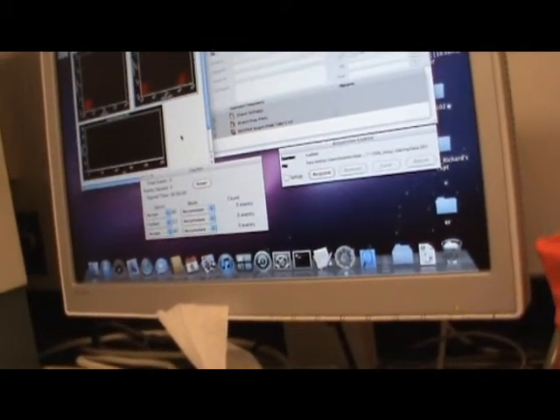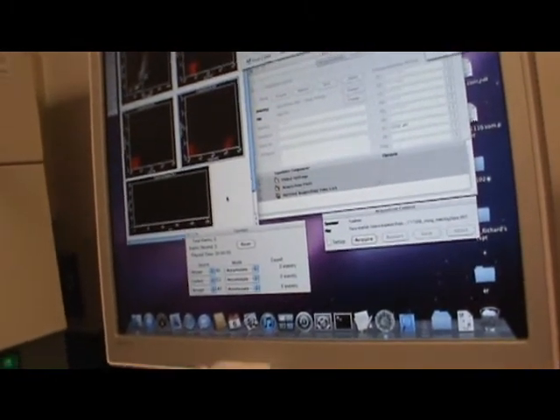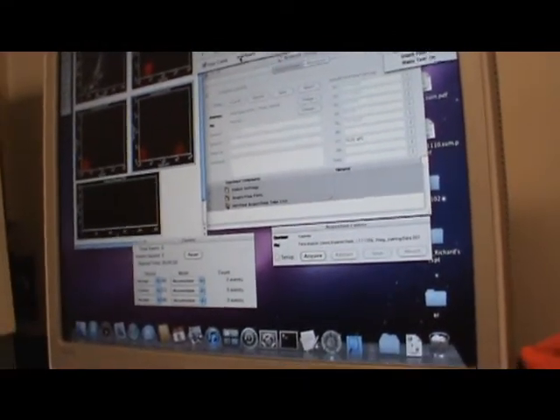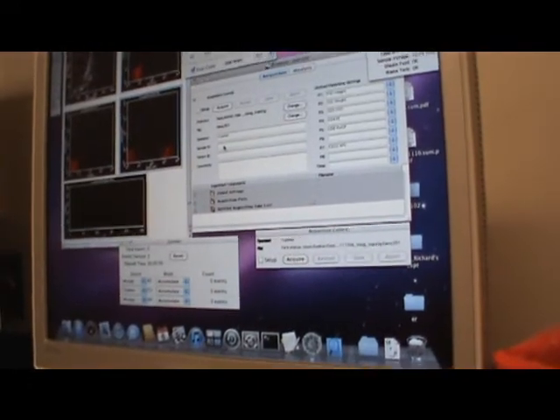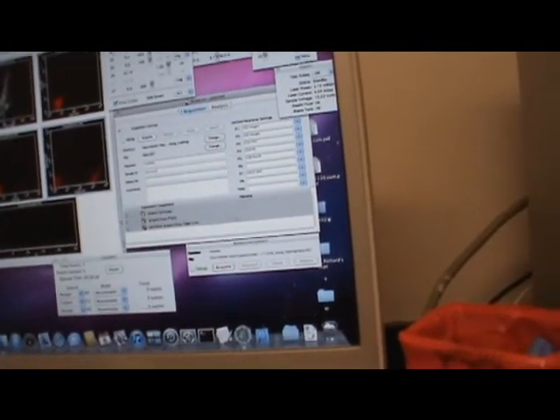Now, these were my single stain controls to correct the compensation. Now I have my fully stained tube which has 4 colors. I also need to record. Actually, compensation I'm not recording, I don't want to worry about it. I just record one tube to show you that this number is going up. I put the sample ID here, I call this unstained, and I say acquire. It's acquiring.